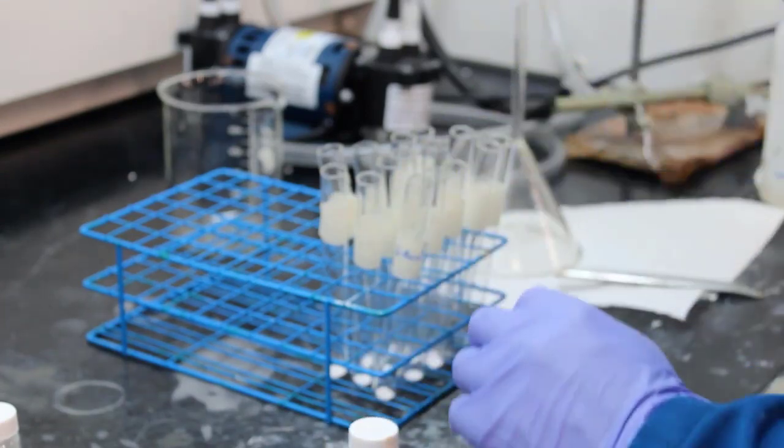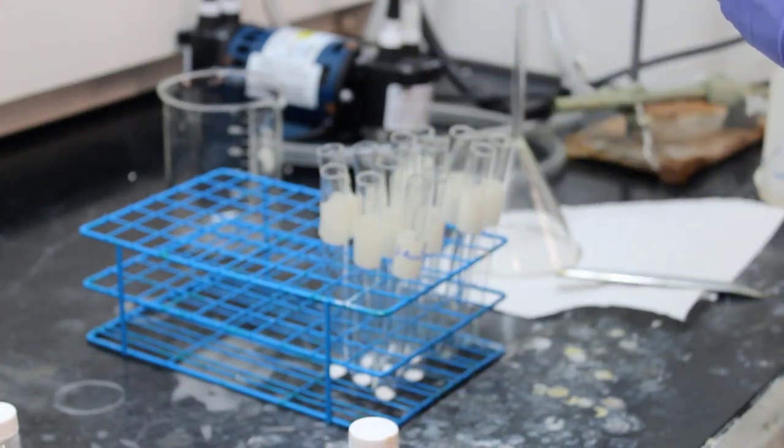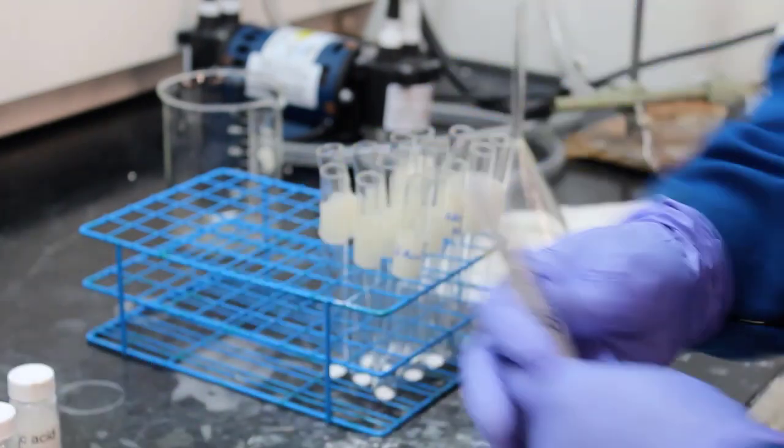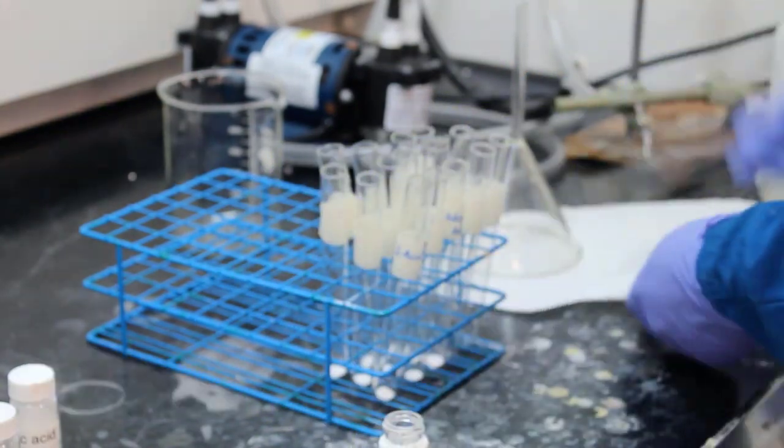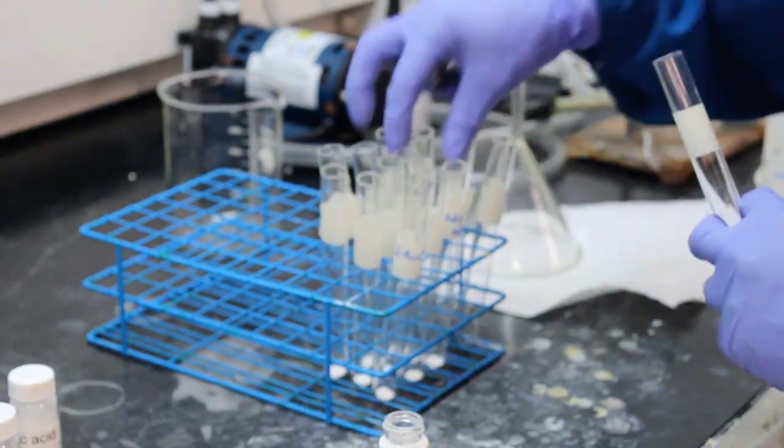Alright, next up, after adipic acid, they're going to start adding, well, hang on, they're making notes. They're writing on the test tubes. You always want to write on your glassware. Next up we have acetanilide.